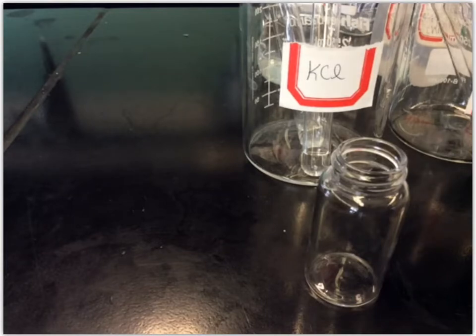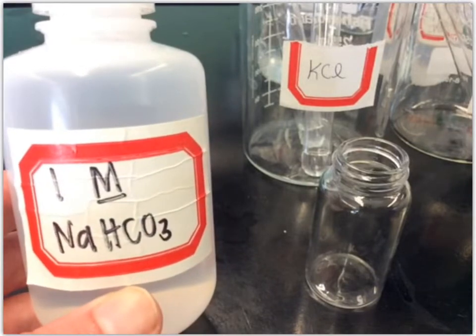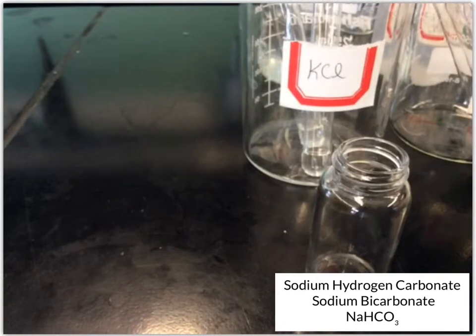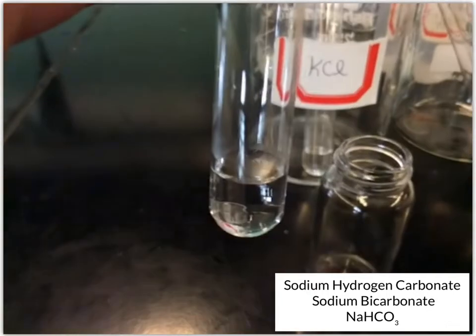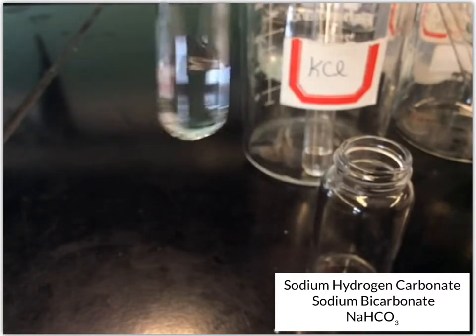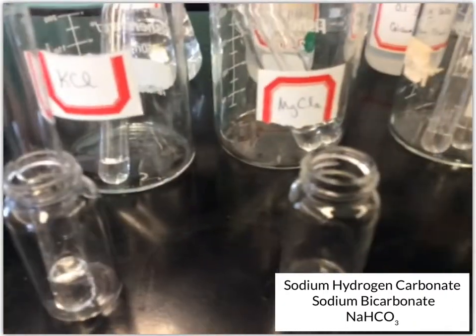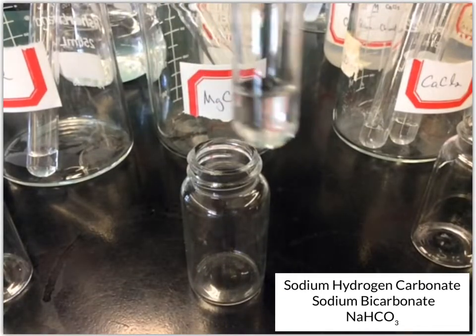Okay, next we're going to test all of our solutions with sodium hydrogen carbonate, or sodium bicarbonate. So I'll add about 10 drops of this to each solution, just like before. So we have the potassium chloride, okay, so no change, still a clear colorless solution. Next up we have magnesium chloride.